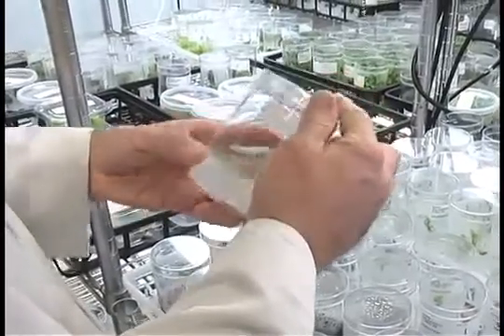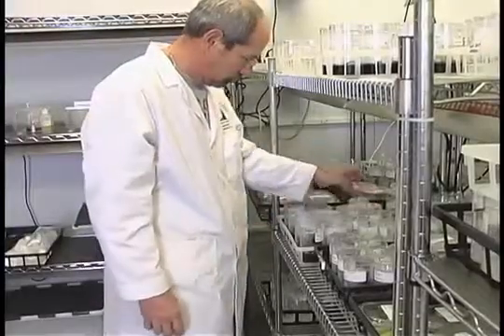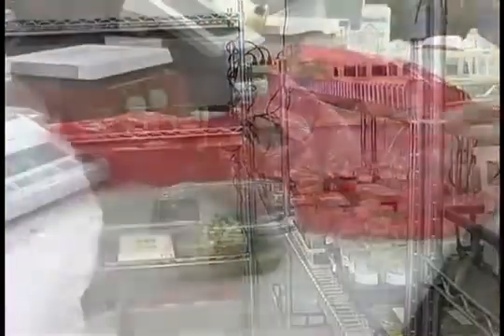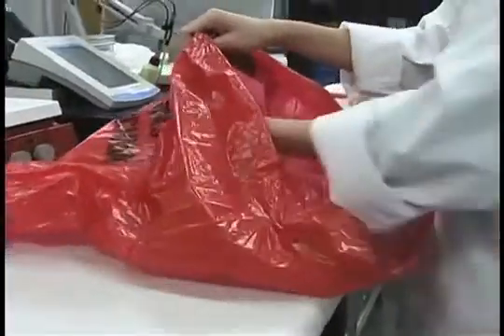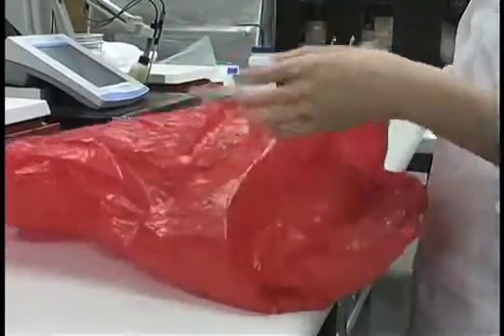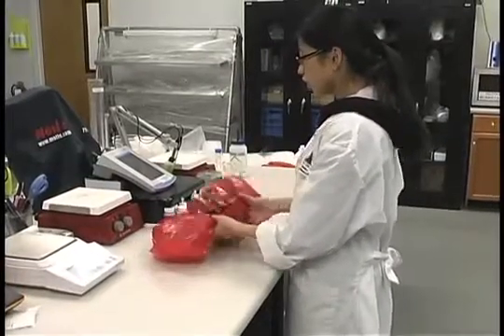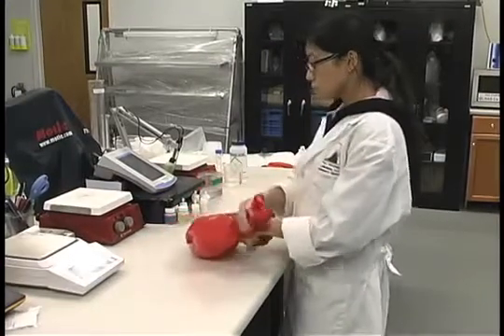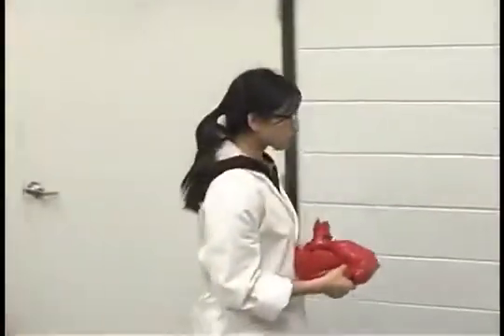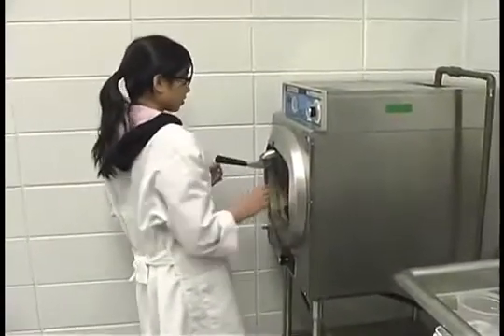Do not open containers that are contaminated — the contaminants could be harmful. The only safe way to dispose of these is to autoclave or pressure cook them for 15 minutes at 15 psi. Contaminated plastic dishes can be placed inside a large can or autoclavable bag to be sterilized before discarding.